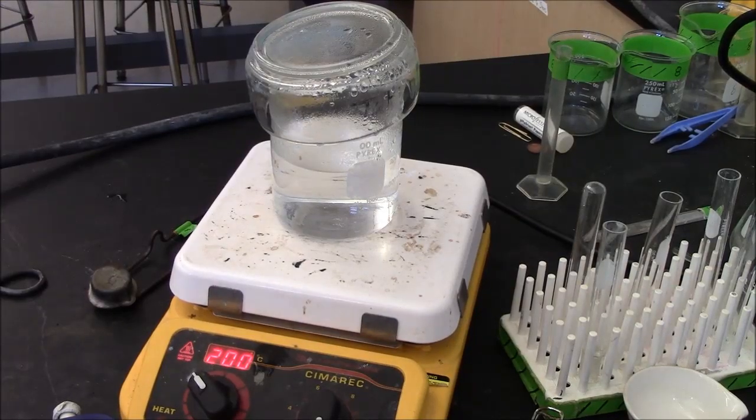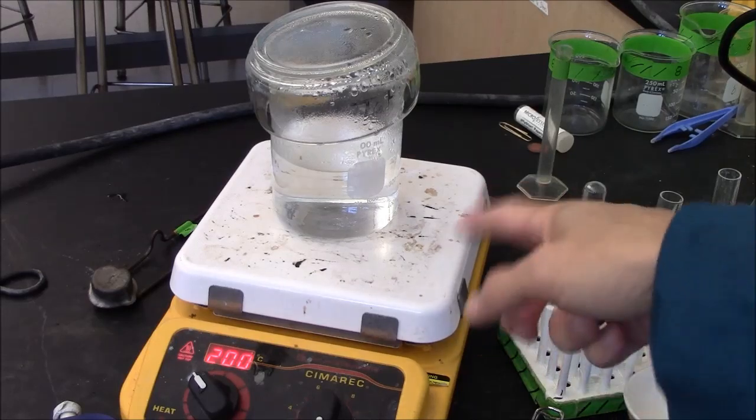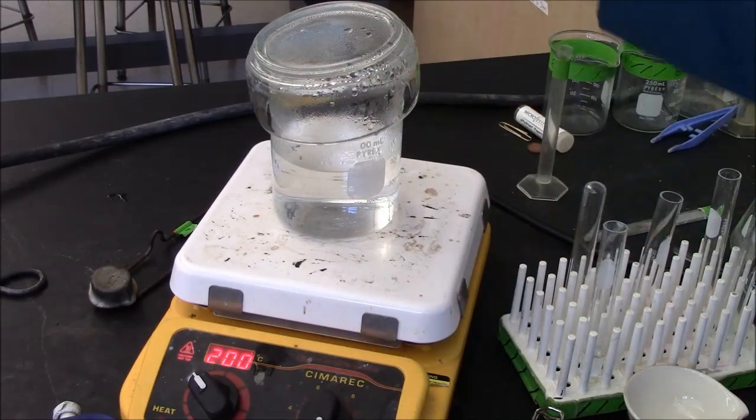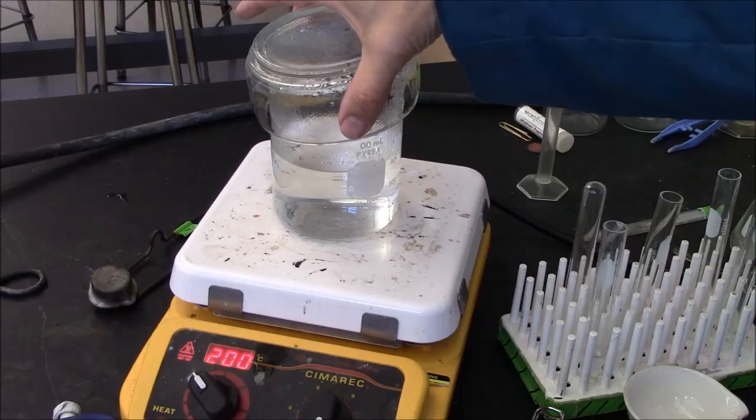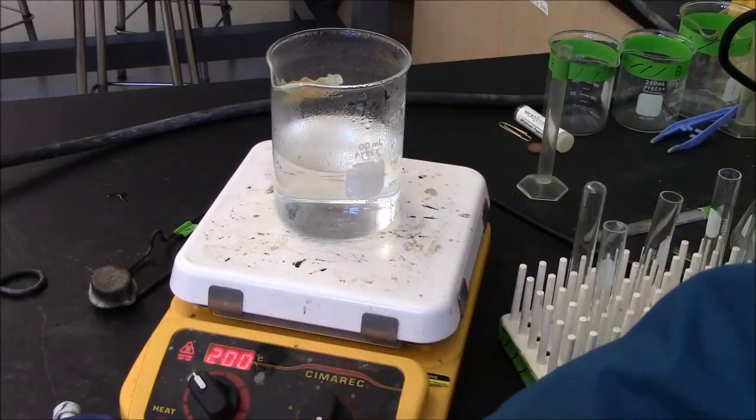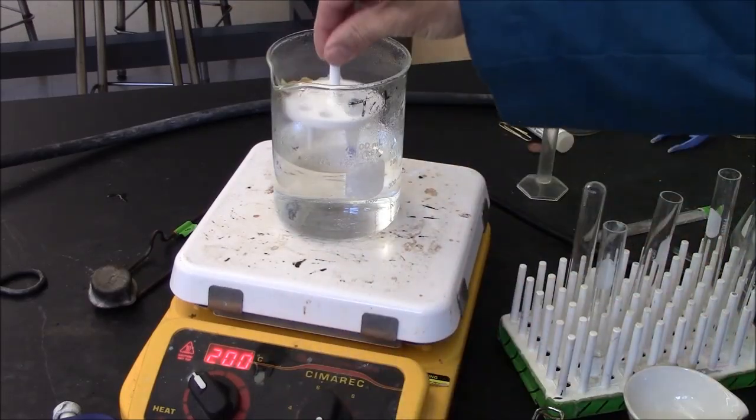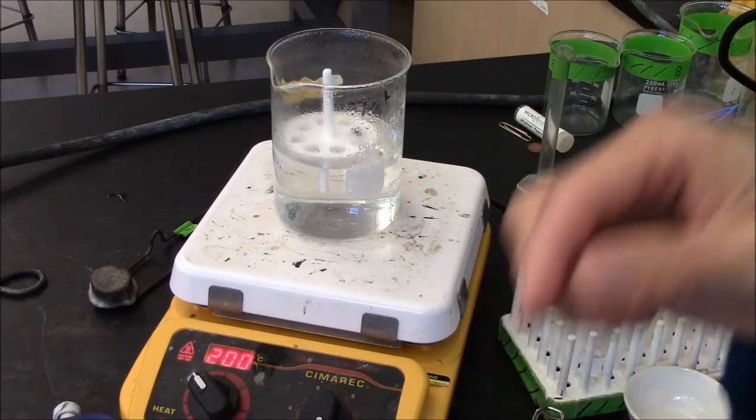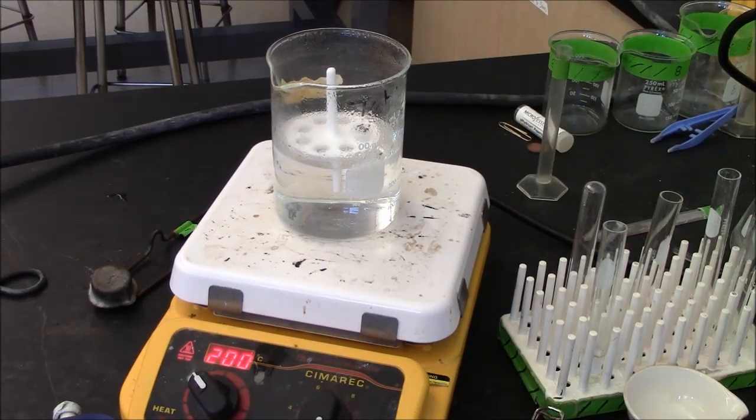Here I have a beaker of hot water. I microwaved the water until it was boiling and now I'm keeping it hot on the hot plate. The lid is hot. I will rest my flotation device in the beaker, as shown here.